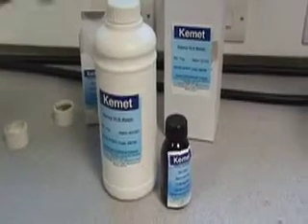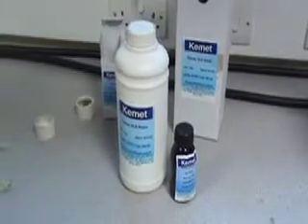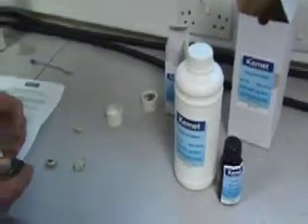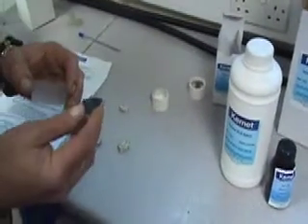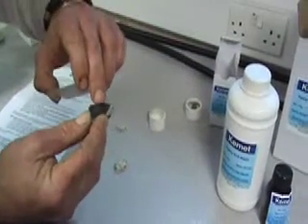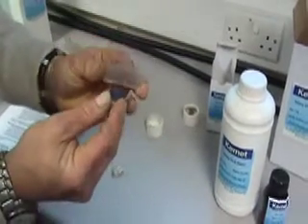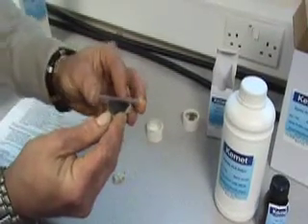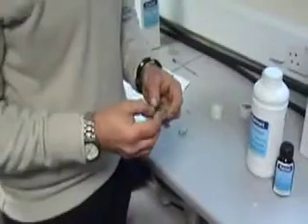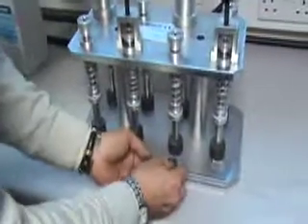We recommend the use of our epoxy resin and hardener. Mix correctly to a 10 to 1 ratio, resin to hardener. On non-porous rock samples, apply the glue along one edge, then with the frosted side of the slide gently squeeze together, removing all air bubbles. With your glued rock sample, place onto the geofix.